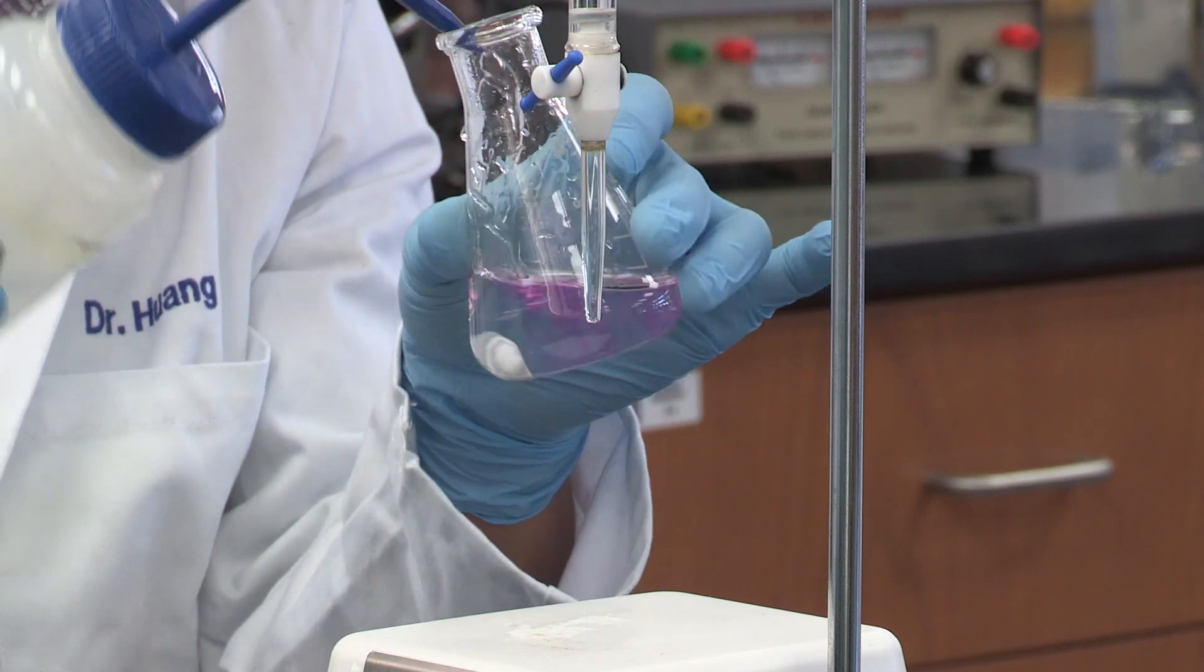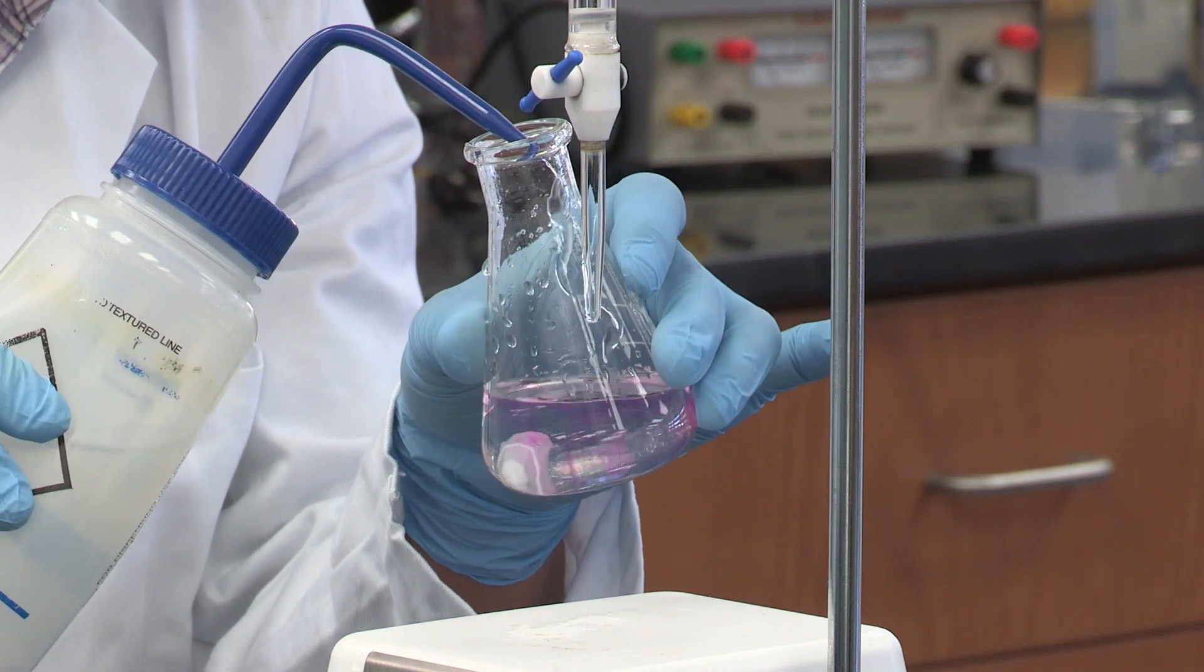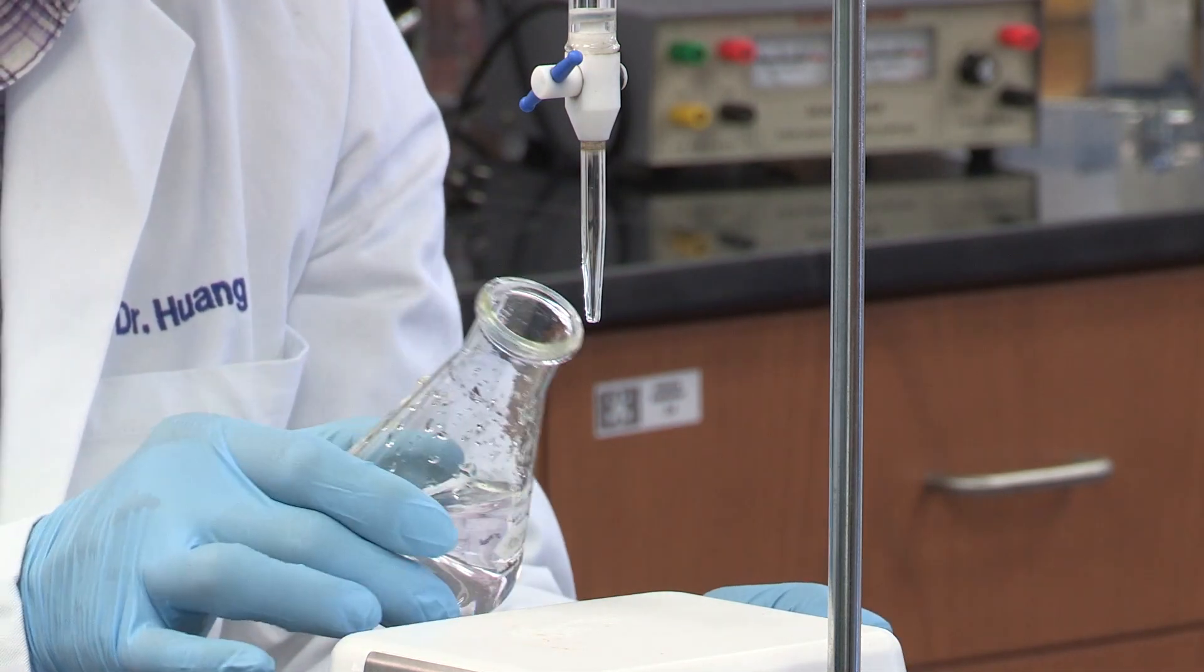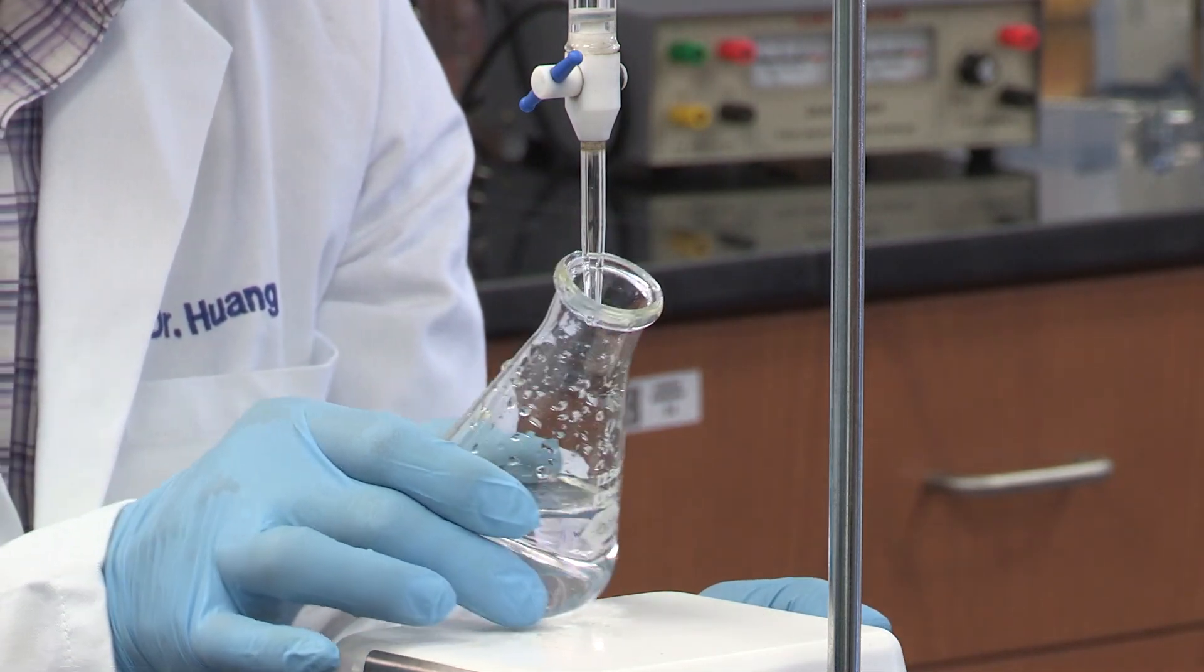I want to emphasize this is the most important step for this whole experiment. If you screw this up, you have to start over.